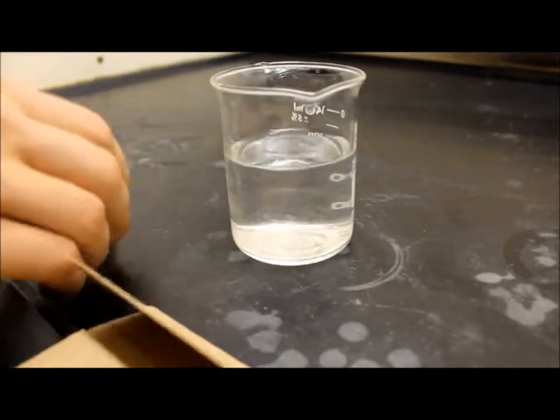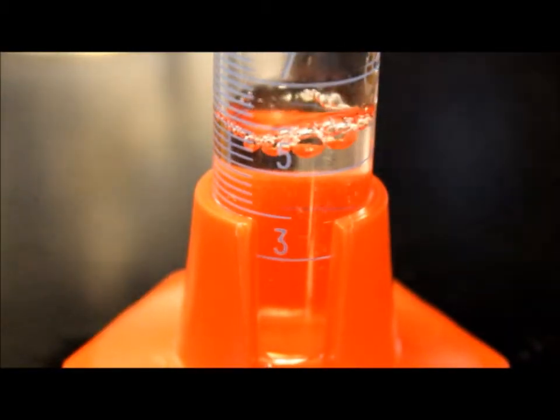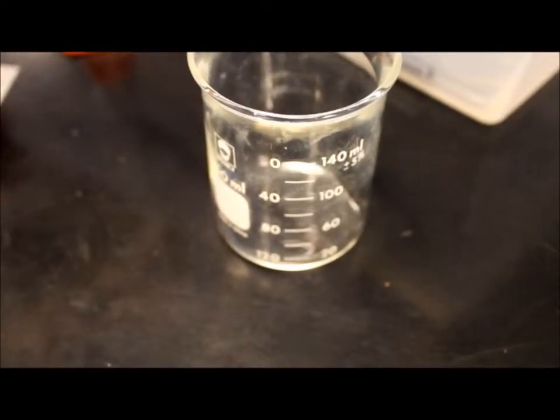Now that the preparations are over, it's time to start the lab. Measure out 5 milliliters of solution A and transfer this to a clean 150 milliliter beaker.